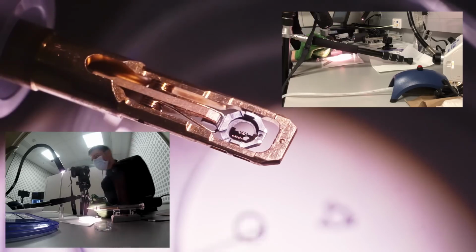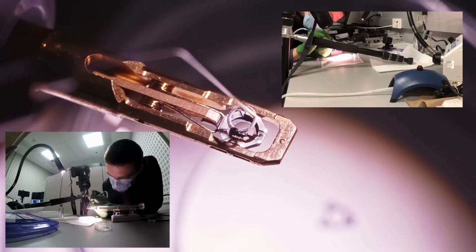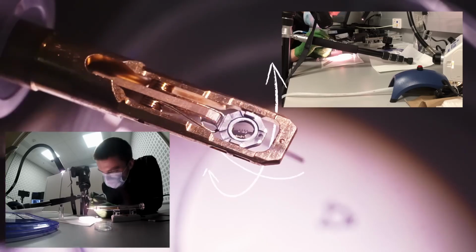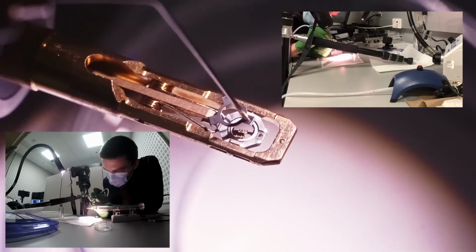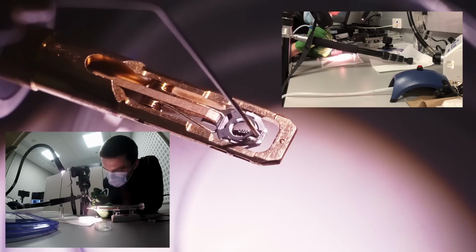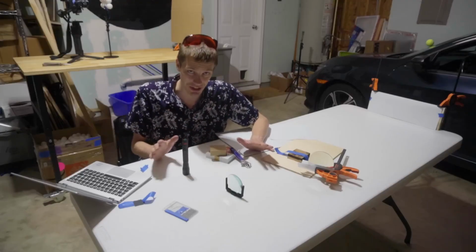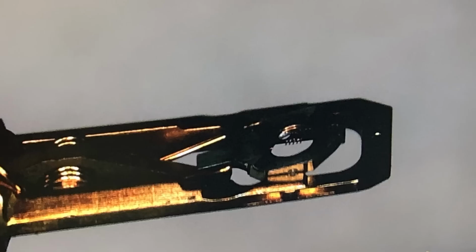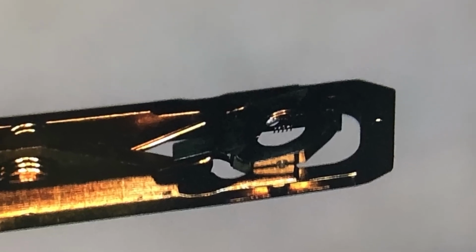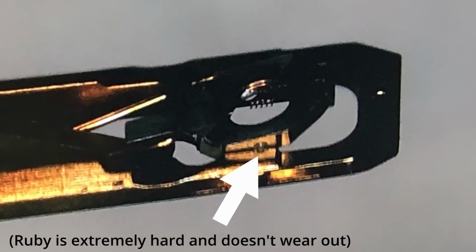It's also worth appreciating that even this tiny sample stage is itself a miniature engineering marvel. It's designed to tilt the sample in 2 directions without translating it in X, Y, or Z by more than a couple microns. It's absurdly precise. This is actually some microscope footage from a time that the holder actually broke. I swear I was not pushing on the clip any harder than I should have been. But you can see that the hinge here that broke isn't a normal ball bearing or something like that. It's actually a ruby, like literally a polished gemstone that runs in a groove.